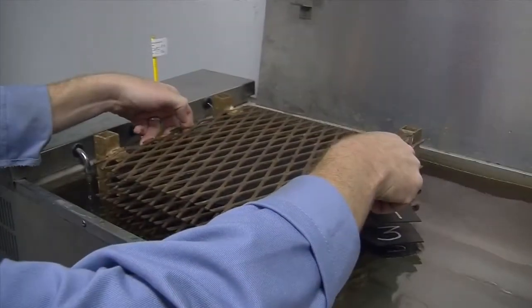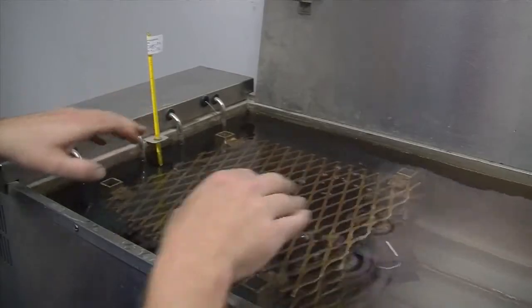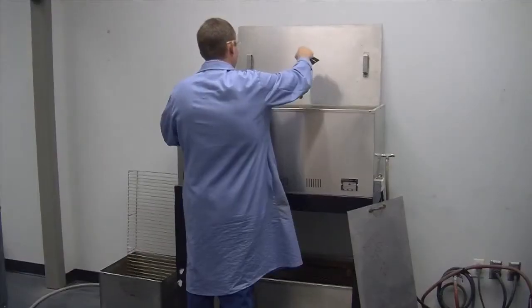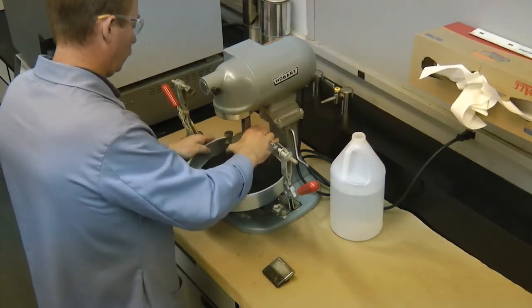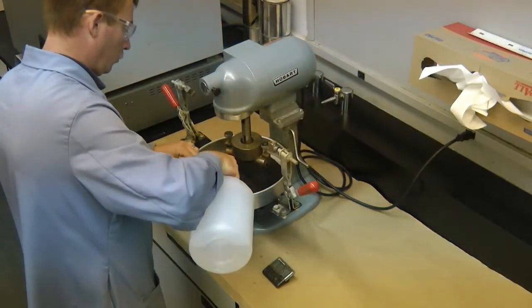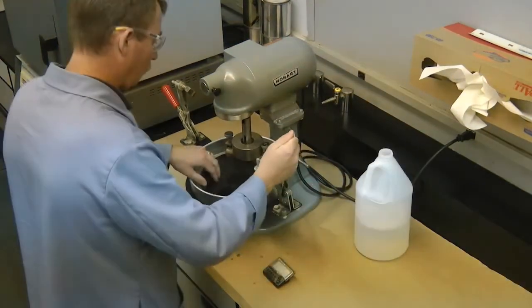Place the specimen in a clean 25 degrees Celsius water bath for 60 to 75 minutes. When performing the 6-day evaluation, testing should be initiated within 2 hours of the end of the 6-day soak period. After the specified time period, remove the specimen from the water bath and place it in a flat-bottom pan. Make sure the hose assembly is attached and in the proper operating position. Clamp the specimen to the pan and mounting plate. Cover the sample with 25 degrees Celsius water to a depth of at least one-fourth inch over the surface of the sample.